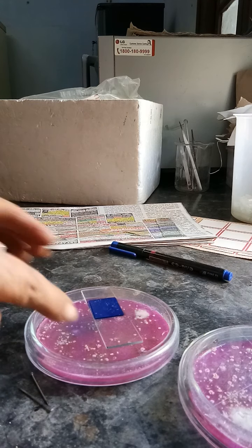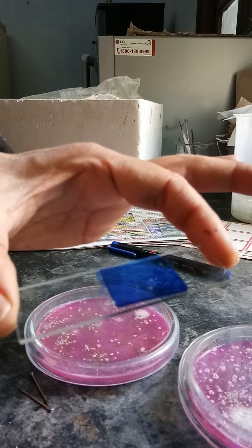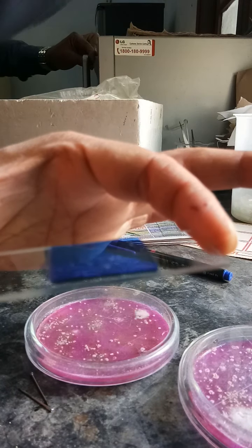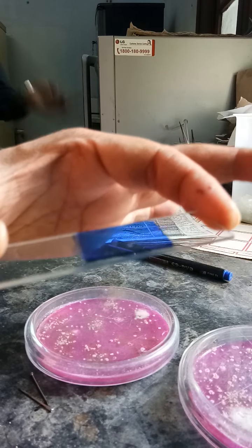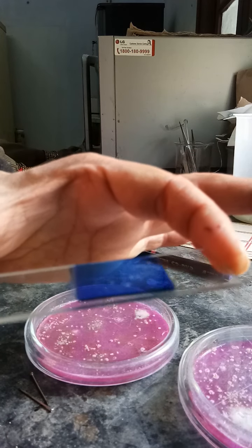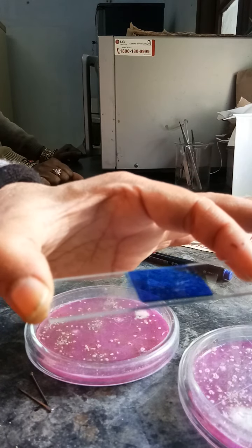Now properly attach the glass slide with the cover slip. Our mounting is ready for fungi. You can see very nicely that it is held by the glass slide and cover slip, with the fungal culture in between. Now we are going to do the microscopy using low power lens and then high power lens to try to identify the culture of the fungi.